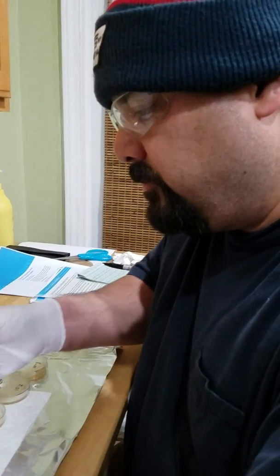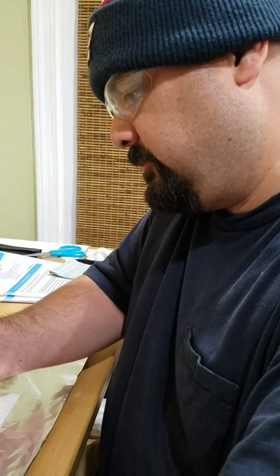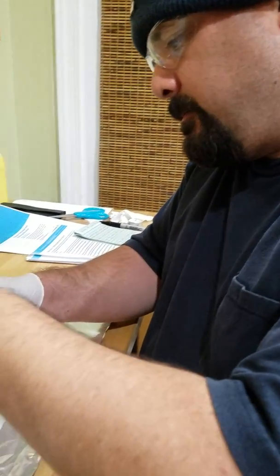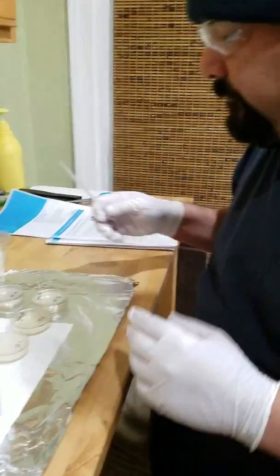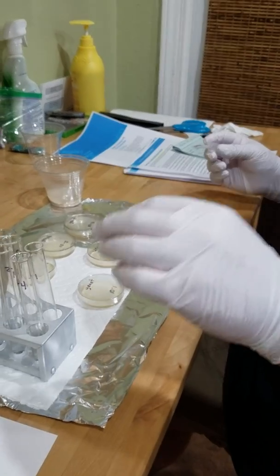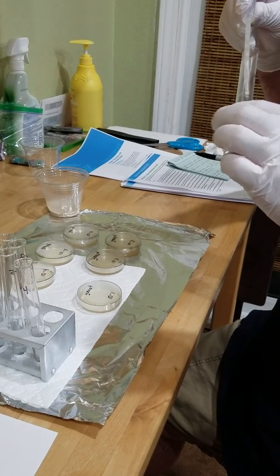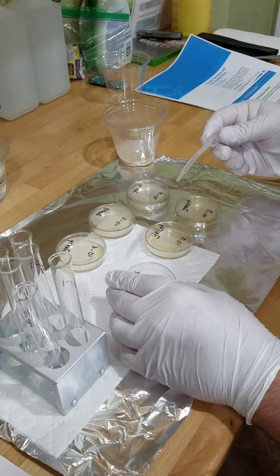Okay, so now we're going to put these into our agar plates, and these are just not cooperating, are they? There we go. So now we've got to put 4 drops in each one. We're going to start with 1 and so on. So we're going to do test tube 1, which would be this guy in the very beginning. We've got to get 4 drops. So let's get some of this guy. We're going to put in 4 drops.